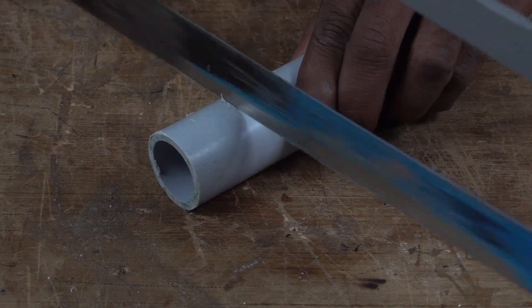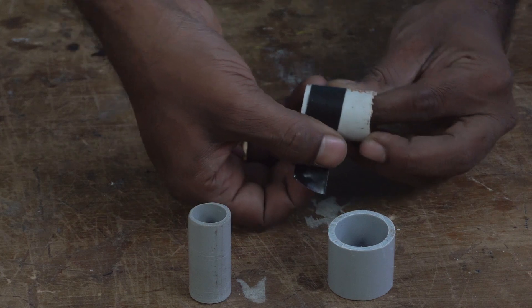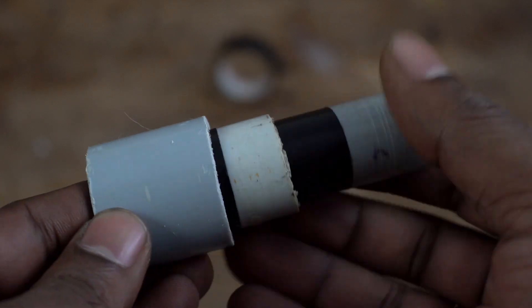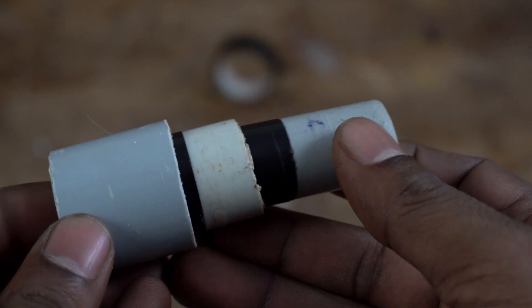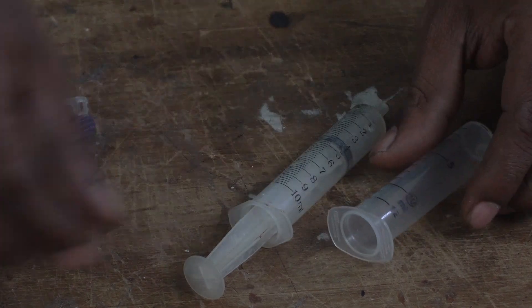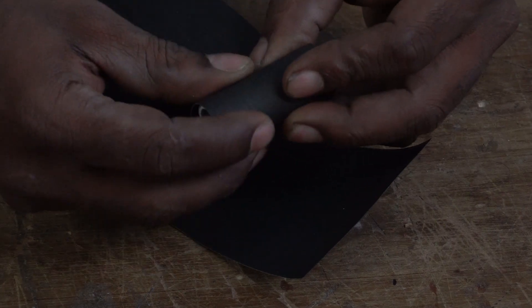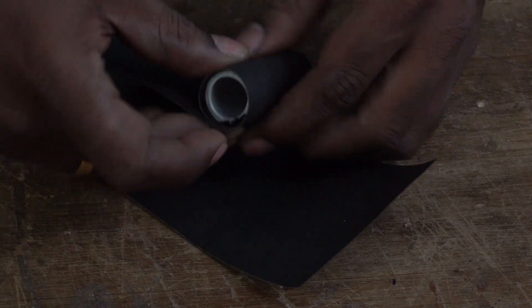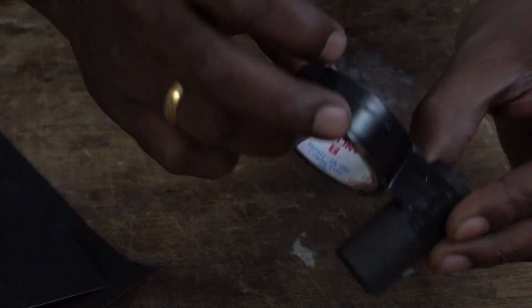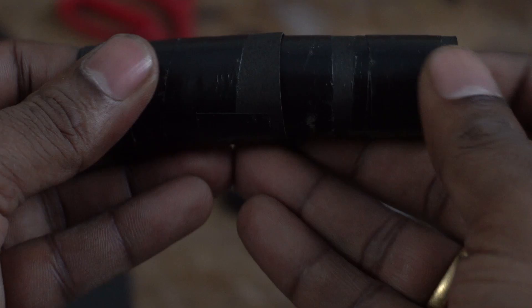Note that you will be needing less than two inches, and that is possibly the size of the microscope itself. If the fit is not snug, wrapping it up with some tape gets us to the goal. The first layer of the tube will have the glass bead and the second one will have another lens, and if required I might add a third lens. Similar functionality can be achieved by using syringes of varying incremental size, by removing the handle and inserting the smaller one inside the larger syringe. Making old school paper rolls could also help — by rolling one layer on a PVC pipe or anything cylindrical, it can be taped and the process repeated over it. Here it looks flimsy because it's only a demo; you can always glue the sides to make it stronger.